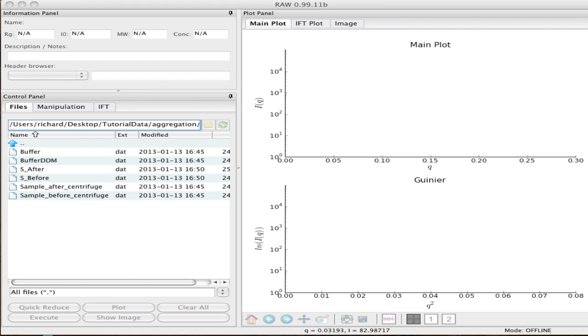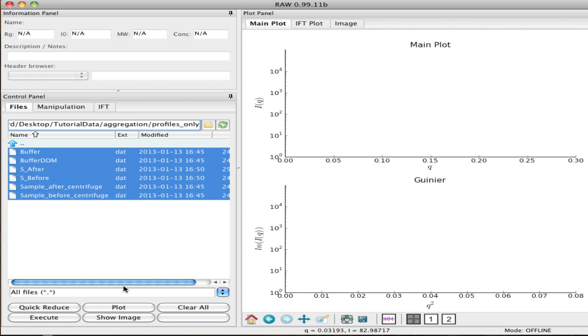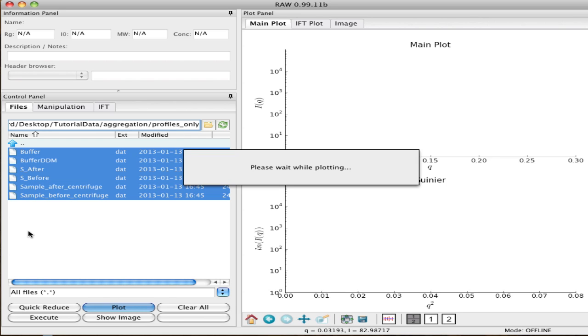This is also a unique example in that we're using a buffer that contains some detergent micelles. That's usually a very tricky thing in SAXS, but we'll show you what a good buffer subtraction looks like under those conditions. So I've already changed to the tutorial data aggregation folder, and you'll find in there something called profiles only. Just go ahead and load all of those examples by highlighting them and plotting them.